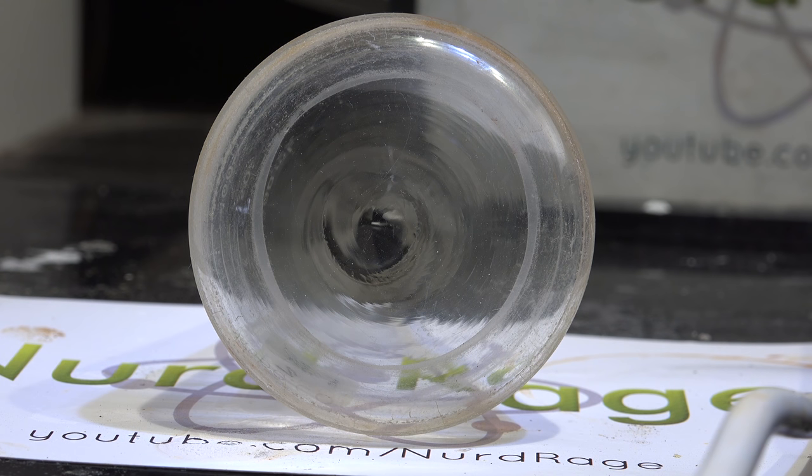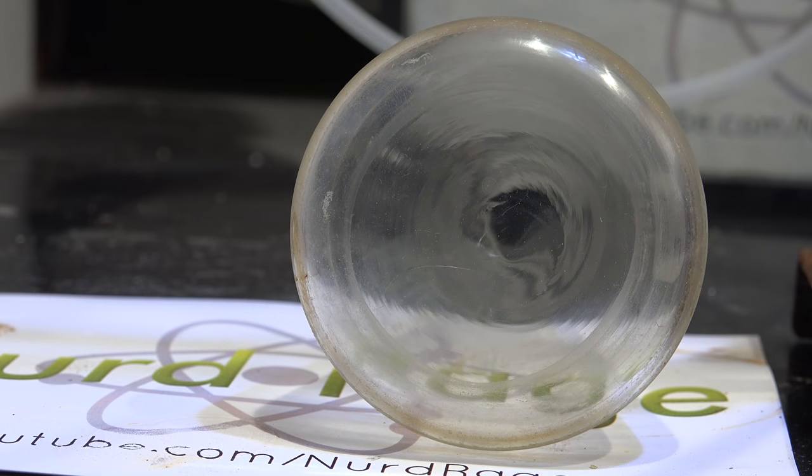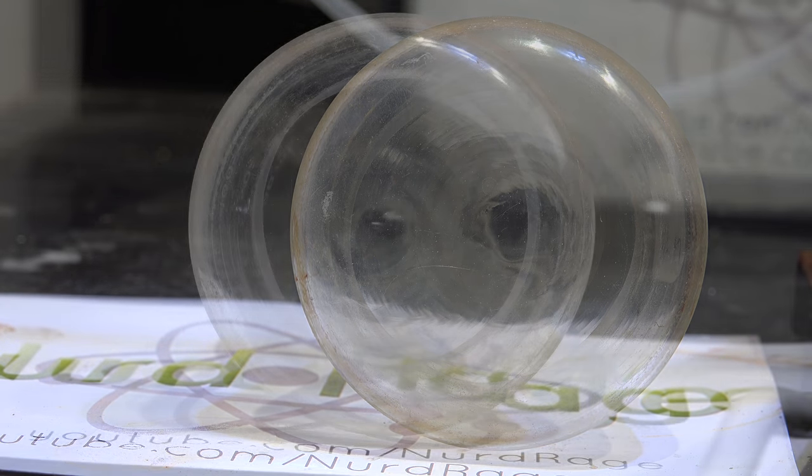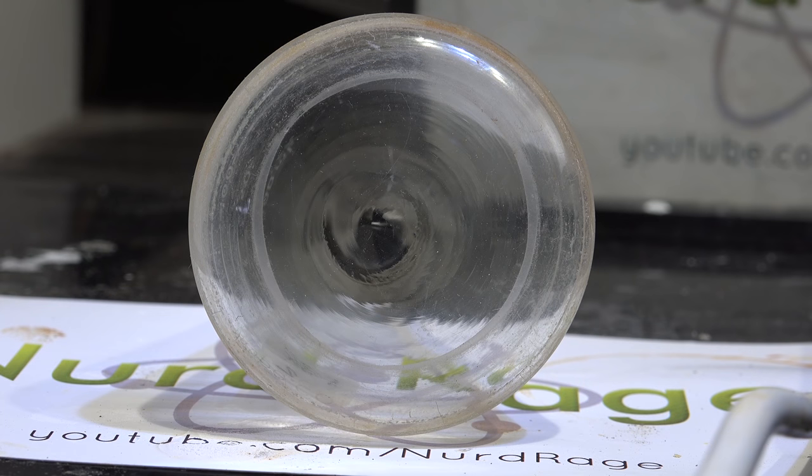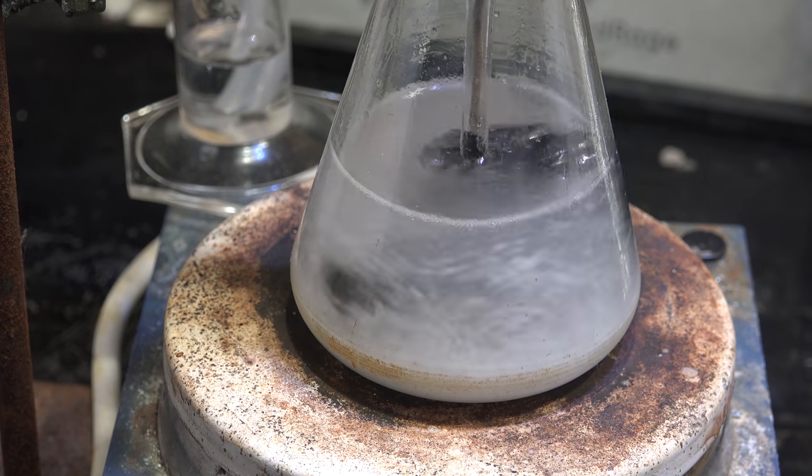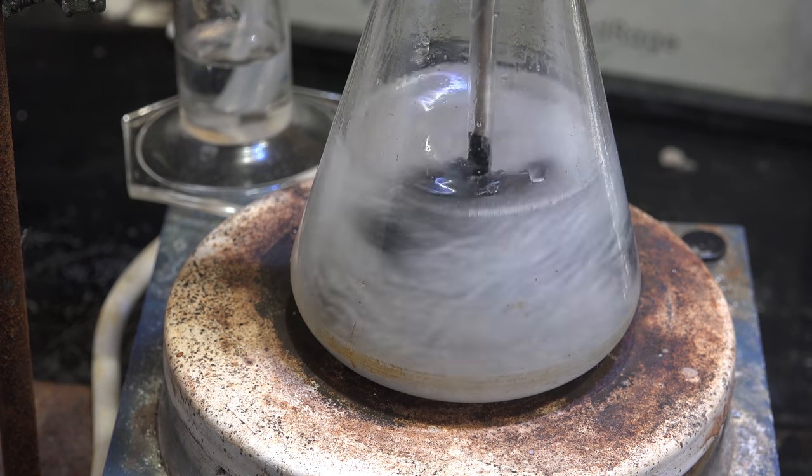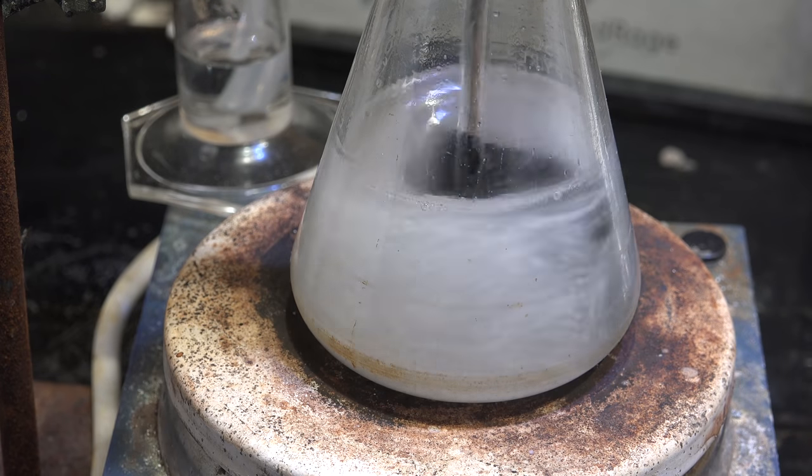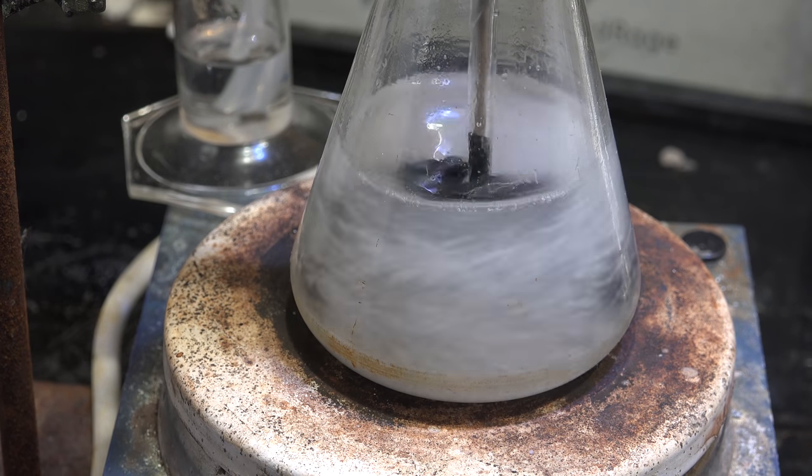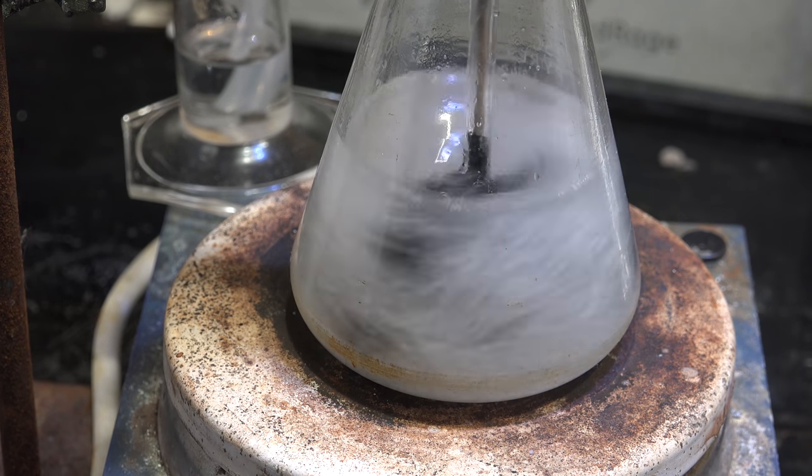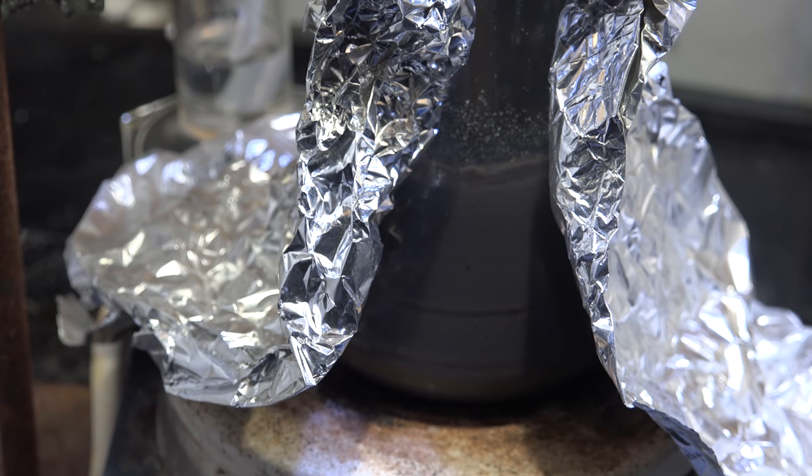Oh that white ring you're seeing that is not present in the original photo is actually there but wet in the original photo so it didn't show up. The new photo is not new damage, it's also on the outside of the flask so it can't have come from the reaction. But bottom line, the reaction worked. We have a way of starting the sodium production reaction by an alternate process that doesn't damage the glassware. And it's very neighbor friendly, unlike the thermochemical dioxane process. So we have solved the jumpstart problem.